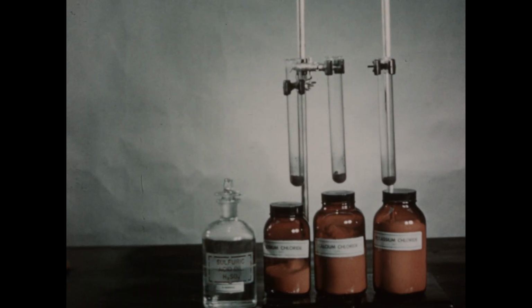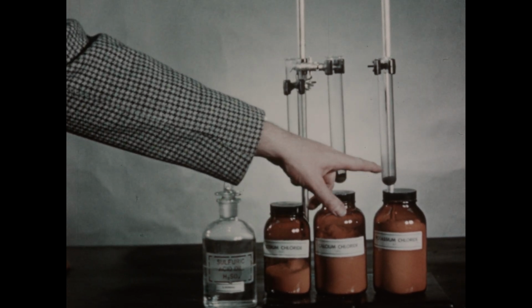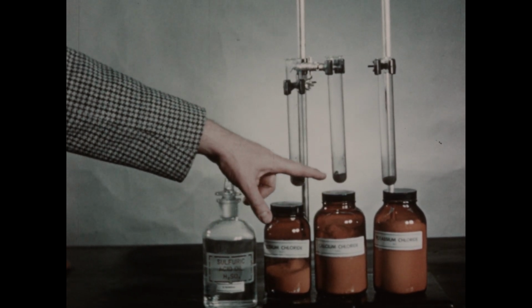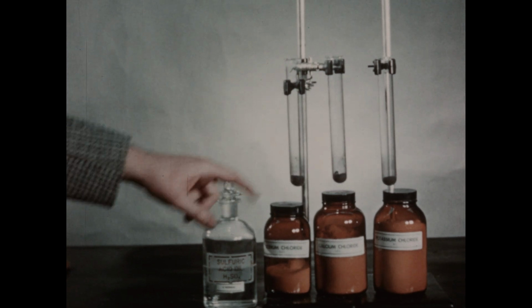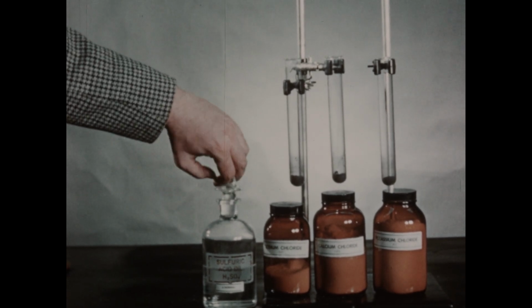The purpose of this experiment is to demonstrate that virtually any chloride salt, when it's mixed with a strong oxidizing agent and in acid medium, will react to liberate chlorine. In these 3 test tubes, we've placed samples of sodium chloride, calcium chloride, and potassium chloride, respectively. And then to each sample of the chloride, we've added some manganese dioxide, which we saw earlier is an active enough oxidizing agent to release chlorine from hydrochloric acid. Now to each tube, we'll add some sulfuric acid.